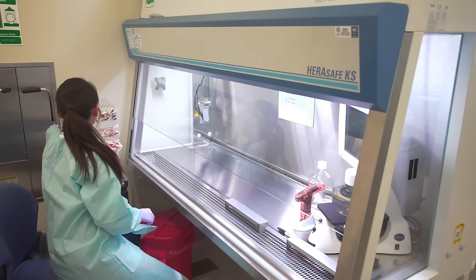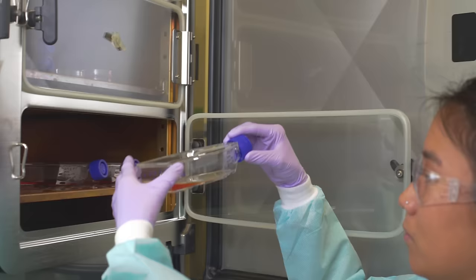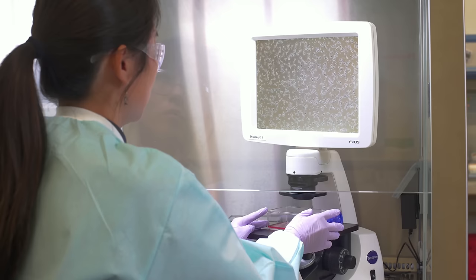Before retrieving your flasks from the incubator, sterilize the hood and have all required supplies at hand. Examine your culture carefully for signs of contamination or deterioration. Handle the cells with care during transport.